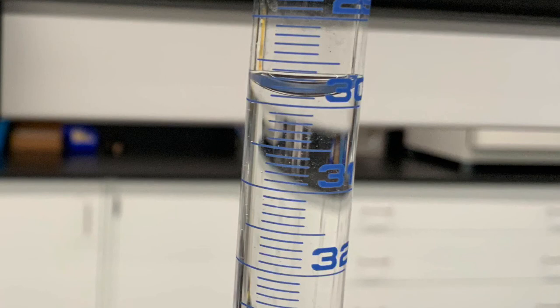Now you calculate how much sodium hydroxide was used in the first quick trial. And you use that number to calculate your plateau volume, which is one milliliter less than how much you used in total for the first trial.